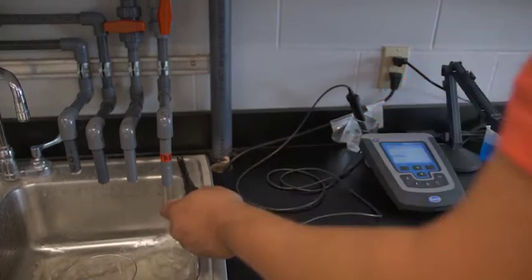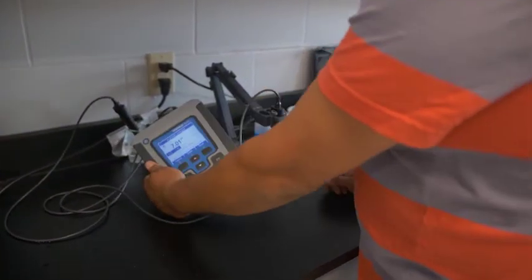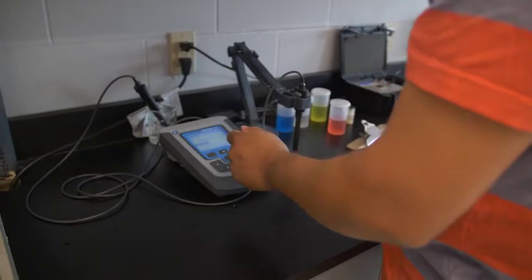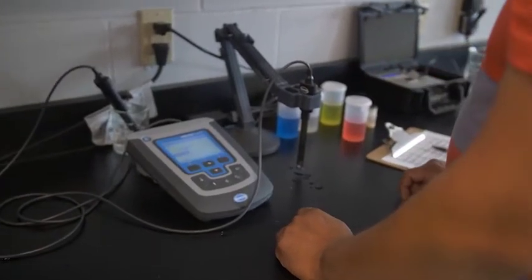So I'll do a 2 point calibration today. So you notice it's a 4 and 7.01. That's because it's a little bit warmer today so it'll give us a little bit of a higher pH.